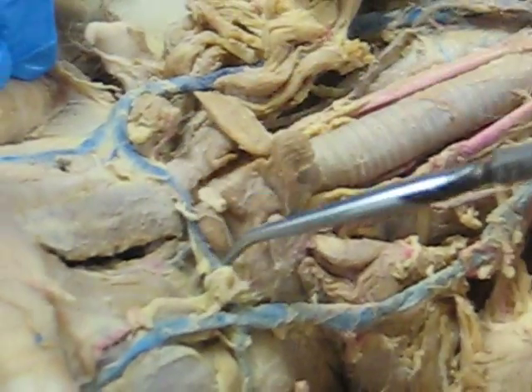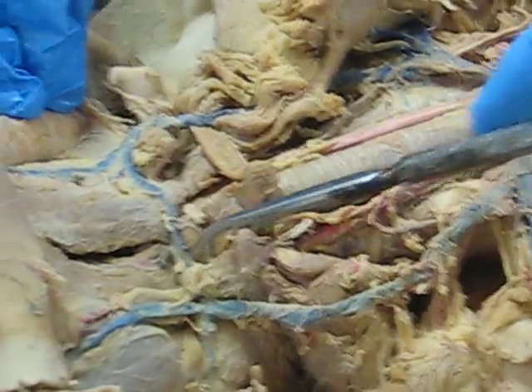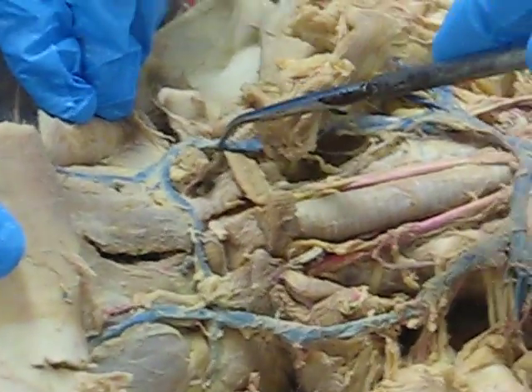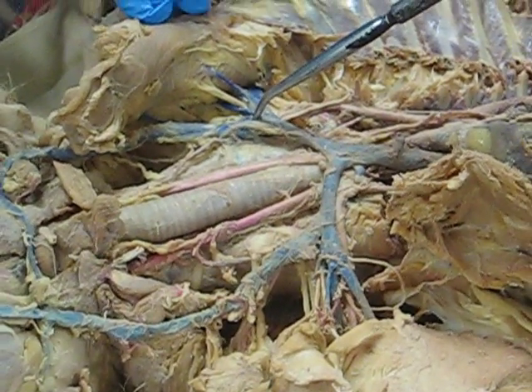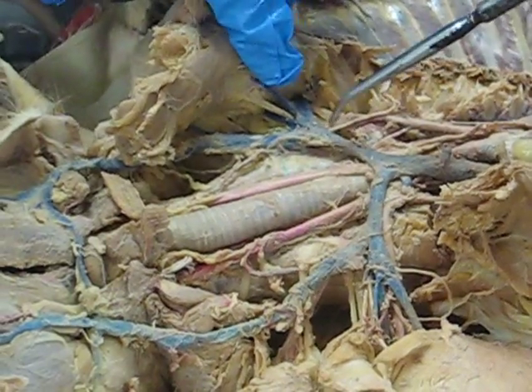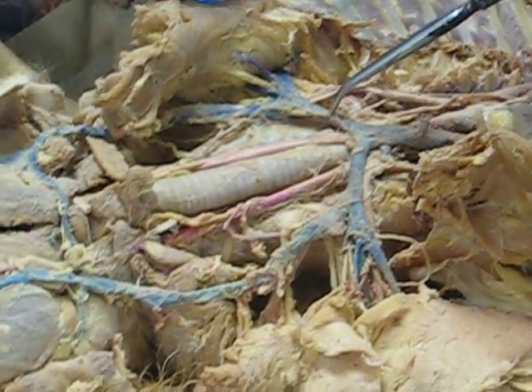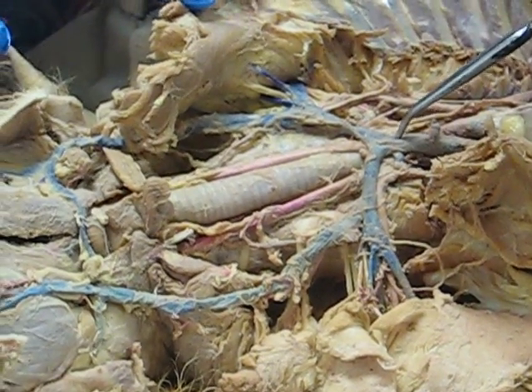This right here is the transverse jugular vein, which right here is your left jugular vein, right jugular vein — the externals. As you come down, you come into the subclavian vein right here, then the brachiocephalic vein, which comes into the superior vena cava.